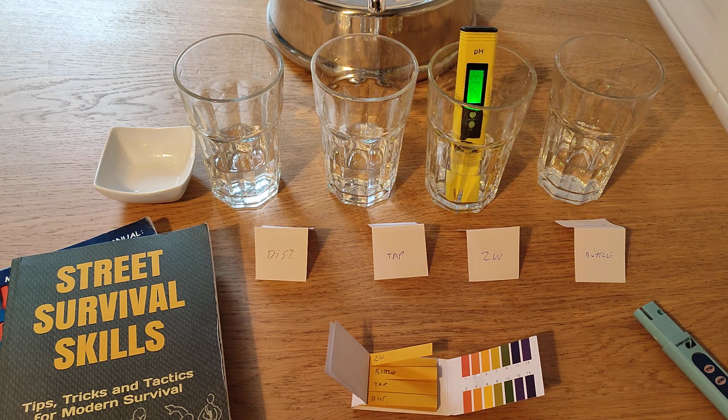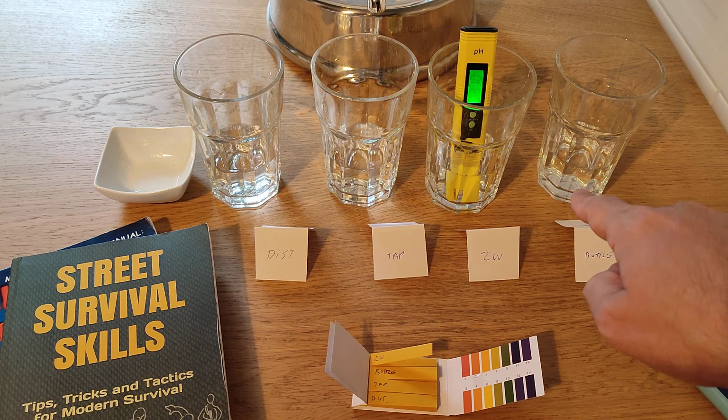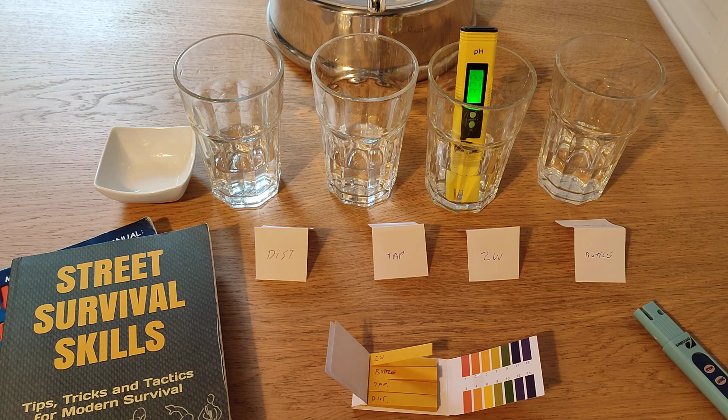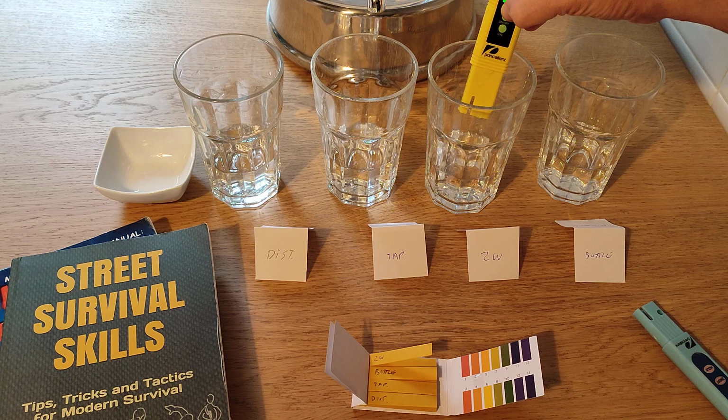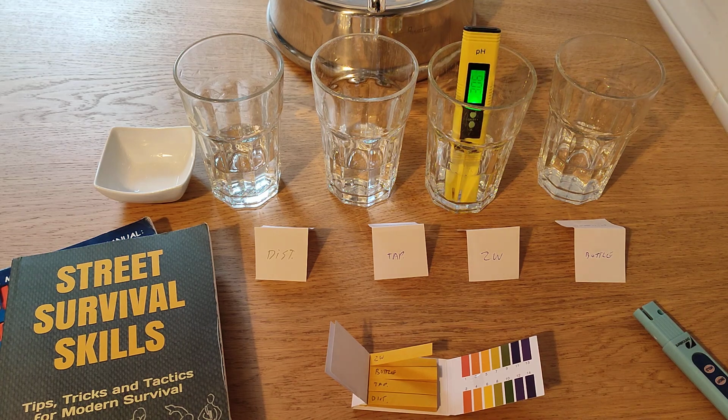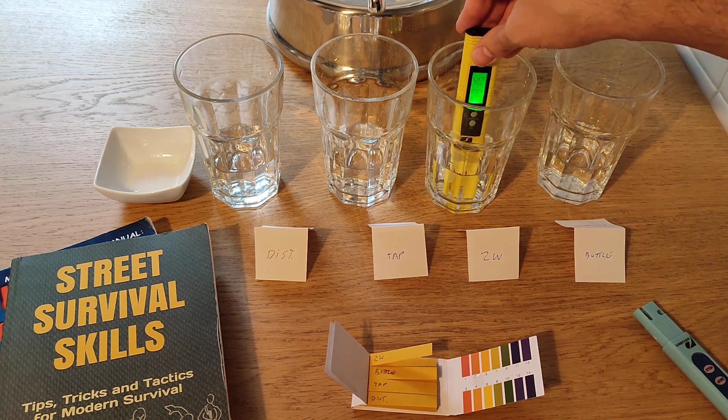Right? This is just basic common sense. Even if this is completely broken, it should be giving me a more alkaline result because I cross-contaminated right now with something that is less acidic, correct? Well, yeah, and then it turns off, but I'll leave it there, and there we go. It starts going up, but really not all that much. Okay, it just gives me a result that is quite acidic.